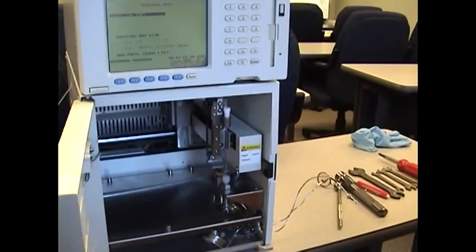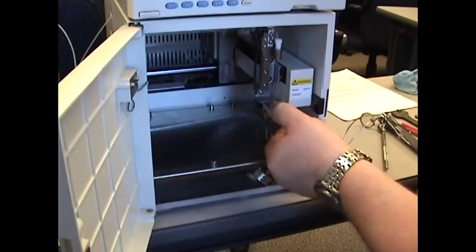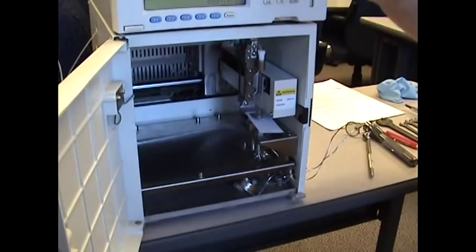Using a thin piece of paper, a business card is usually a little too thick, you just want regular printer paper. You can put it in between the injection port and the needle. This is a very good way to judge the top of that injection port.